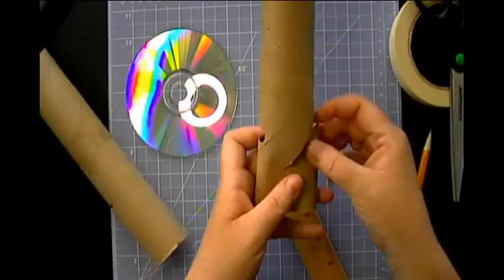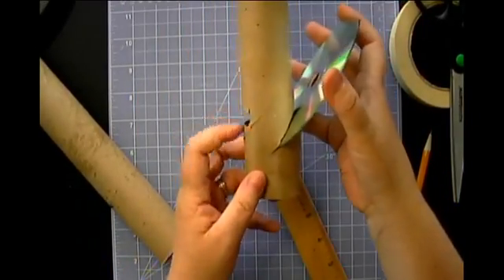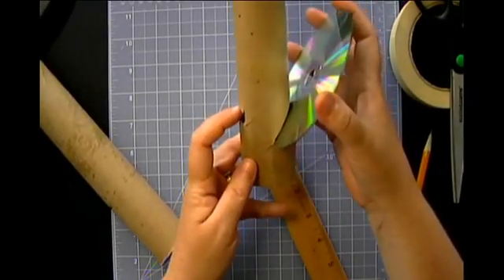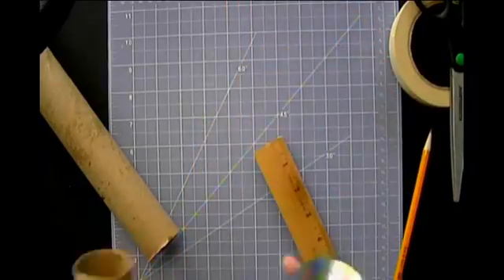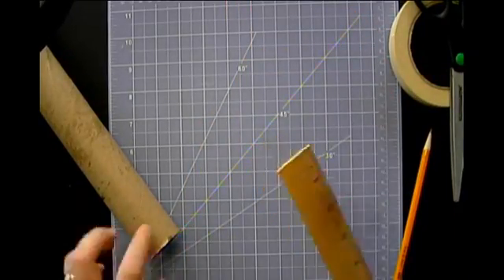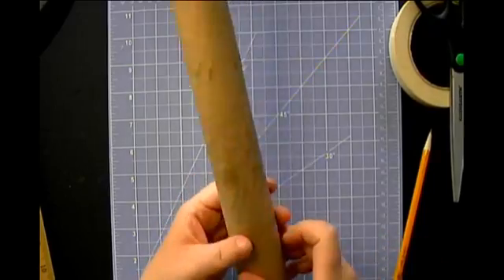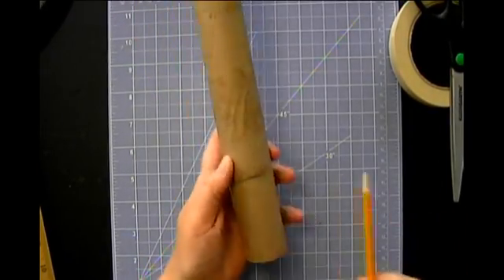Here's the slit for the CD, okay, and there's my viewing window. So I look in this part. I want the top of my viewing window to be pretty well aligned with where my CD is. So that's why measurement is kind of useful for this. Okay, so I've got that marked, both sides. Make sure I've got it good.